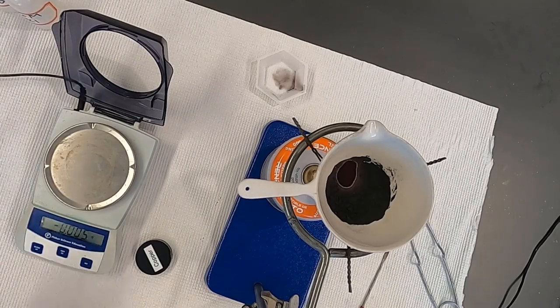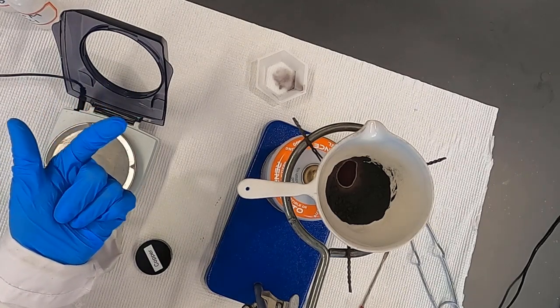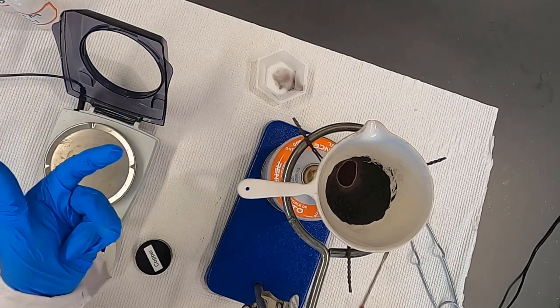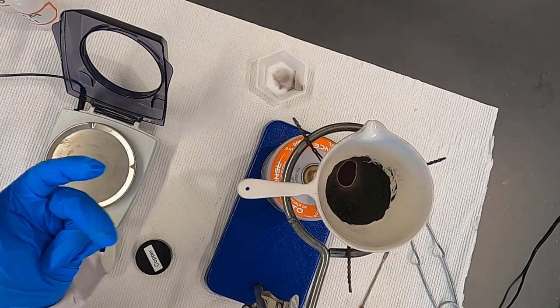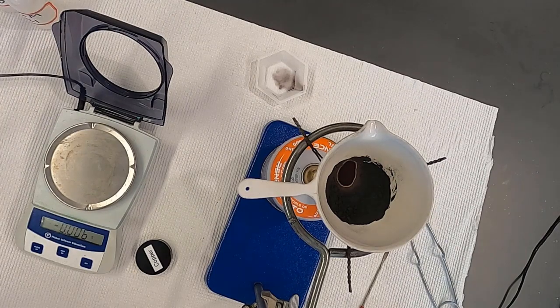So you will have had the mass of the crucible plus copper. Then we went ahead and hit it with flame, and you'll get the mass of the crucible plus the copper oxide. From that, you can go ahead and work through the laboratory and derive that empirical formula.